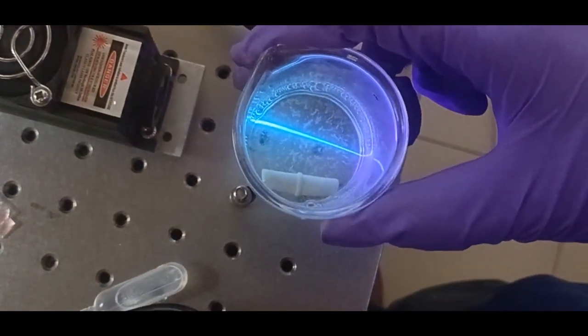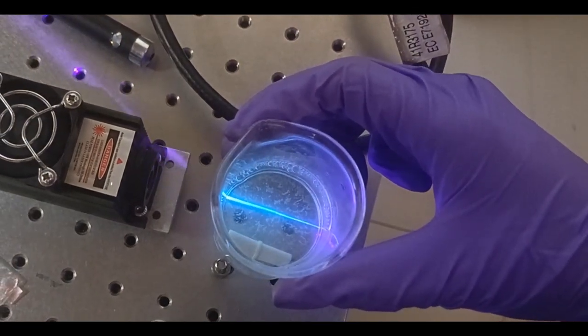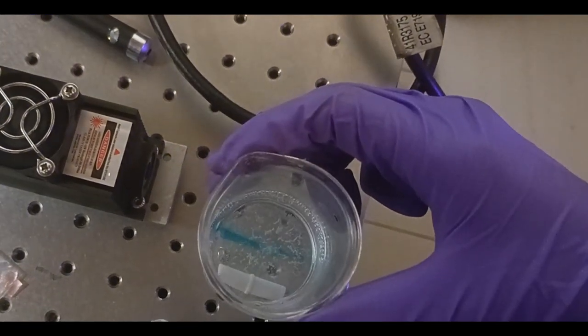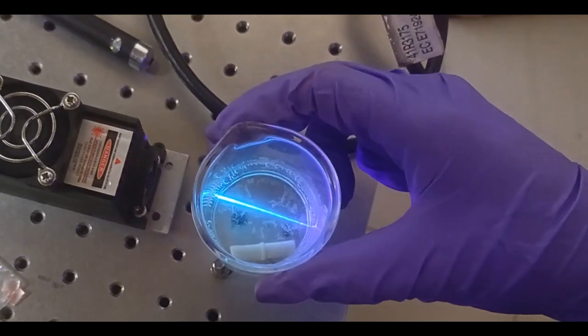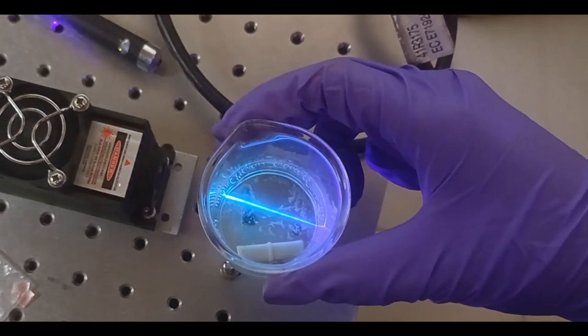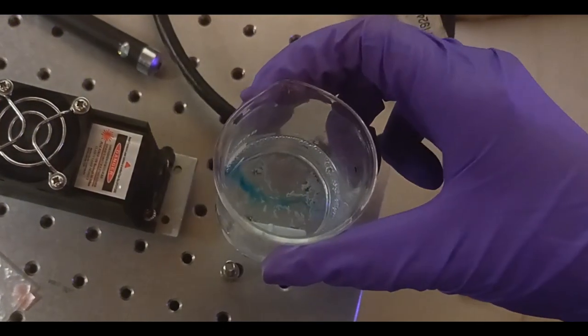This is one form of leucodye. Methylene blue forms a blue colored liquid with water. When we are adding HCl and tin chloride, tin chloride is actually reducing the methylene blue to its colorless form. We know that tin actually exists in two valence forms, one is plus two and plus four.